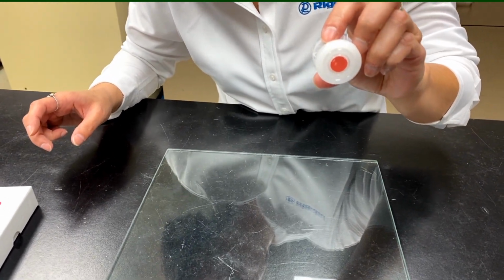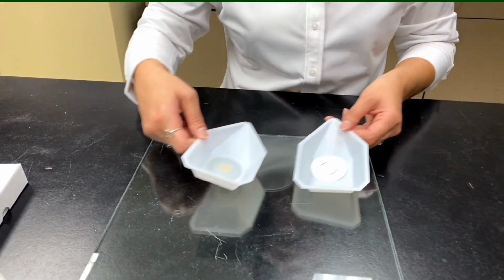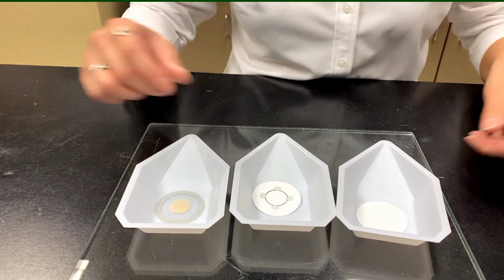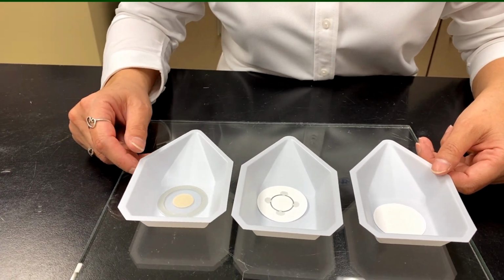Right, exactly. Okay, so moving on, we're going to do liquids. Now, what if you have supernatants in your residual catalyst? You want to see if it's purged into the liquid. Or a parenteral formulation you're looking to analyze. Any kind of liquid sample.